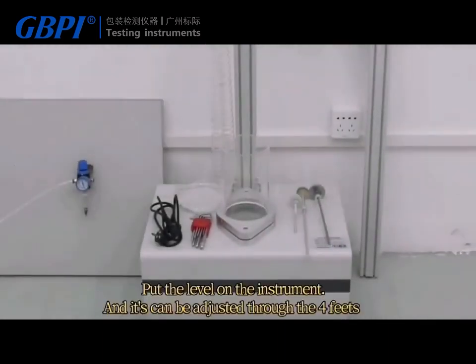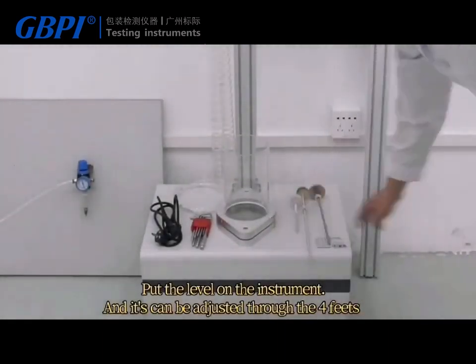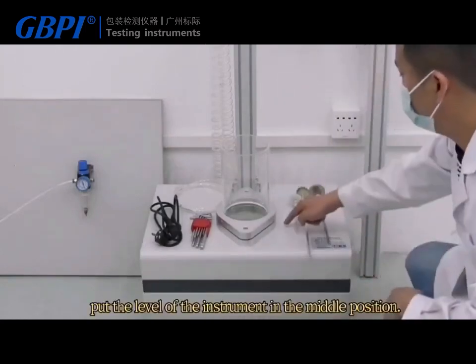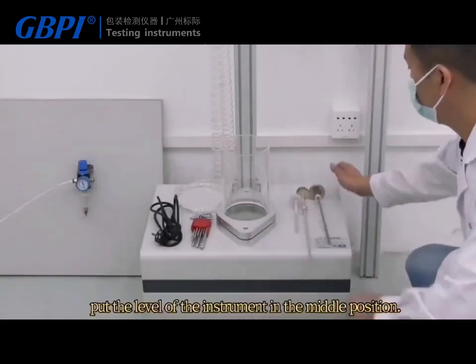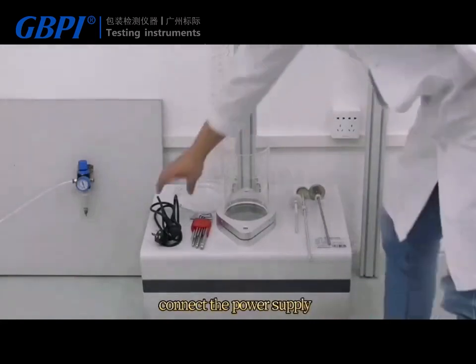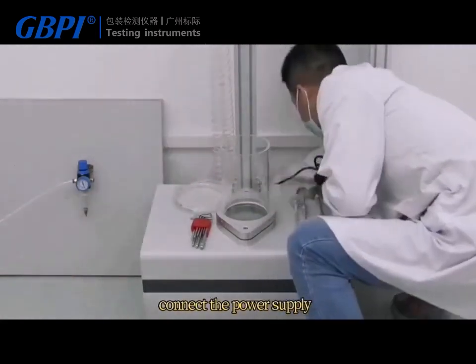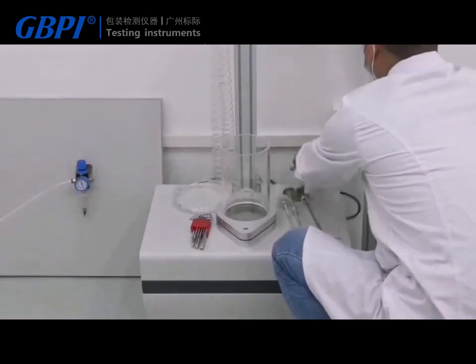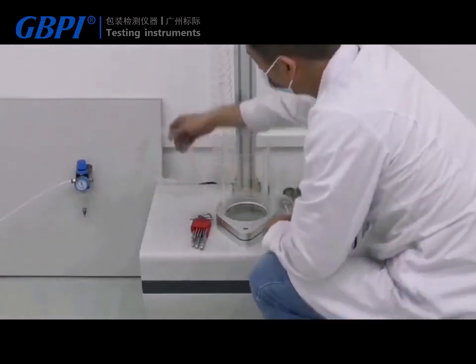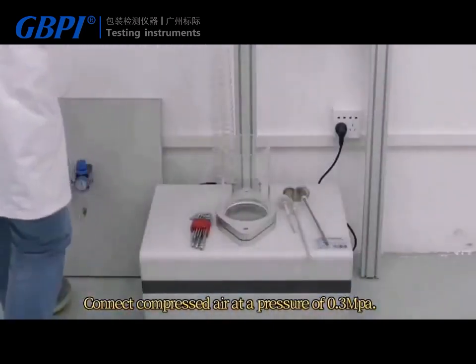GBDL2 installation video. Put the level on the instrument — it can be adjusted through the four feet. Put the level of the instrument in the middle position. Connect the power supply. Connect compressed air at a pressure of 0.3 MPa.